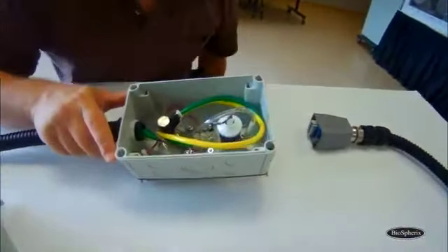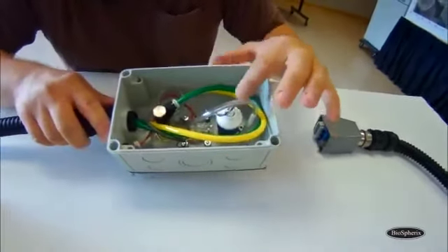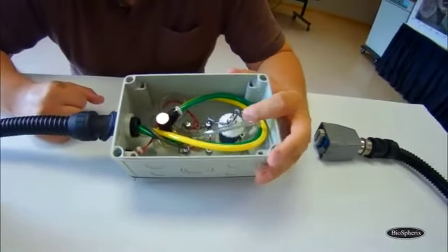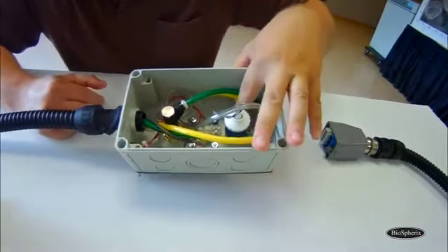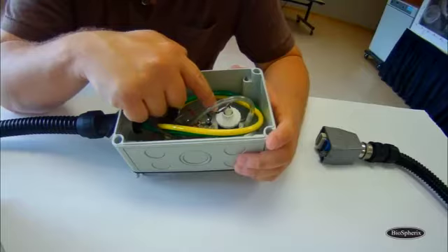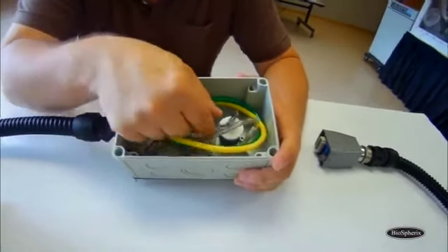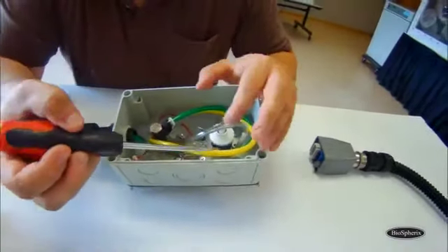and we can see the inside of the pod. So the sensor is going to be oriented in this position. It's going to have this gray and brown cable where the white clip attached to the top, and then it's screwed into a base there. So to get to the replacement, we have to take this clip off. Your flathead screwdriver is going to come into play again.